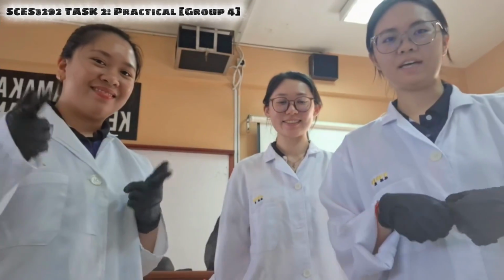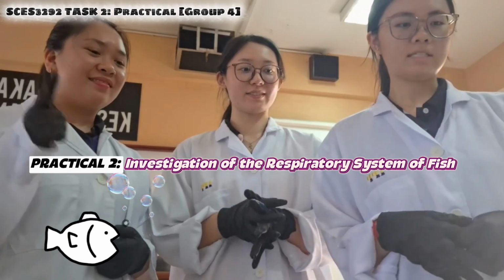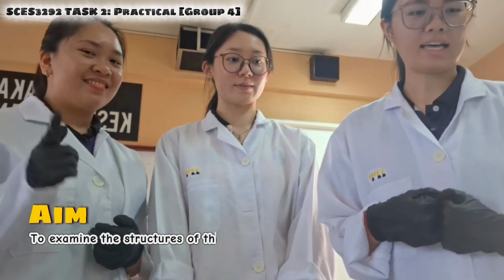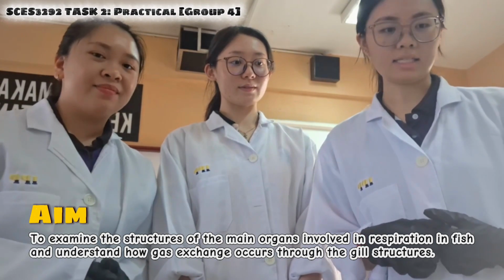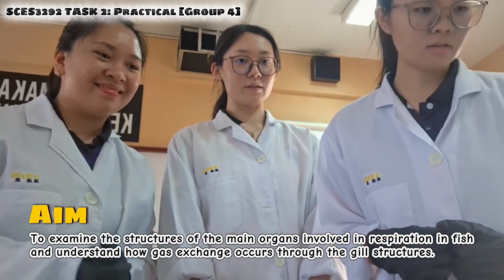Now we are going to carry out the second experiment, which is about investigation of the respiratory system of a fish. The aim is to examine the structures of the main organs involved in respiration in fish and understand how gas exchange occurs through the gill structures.